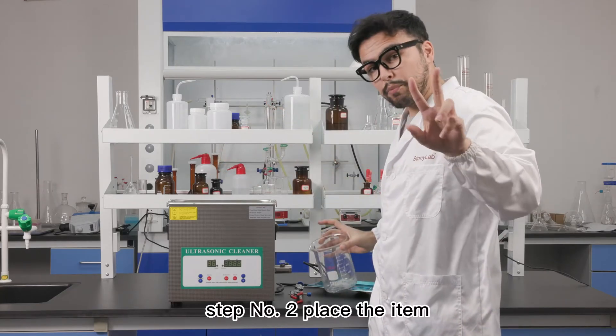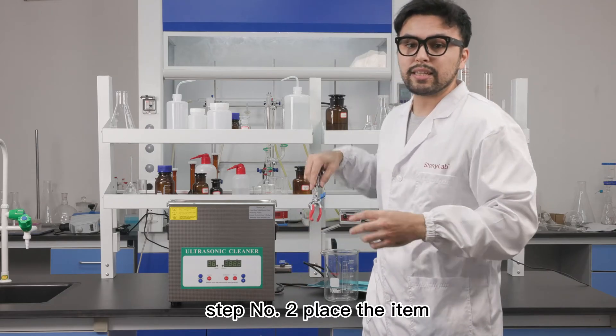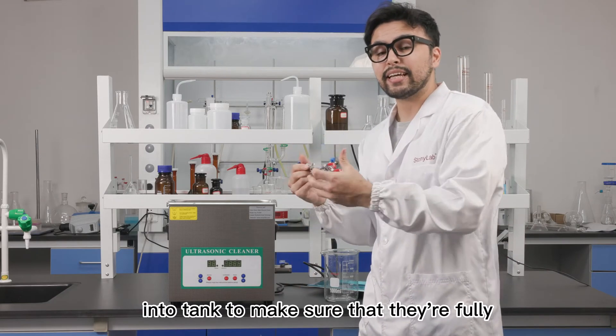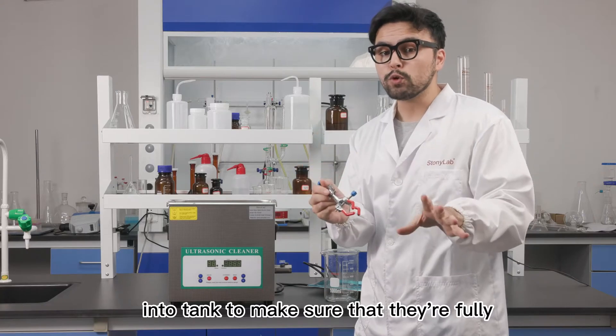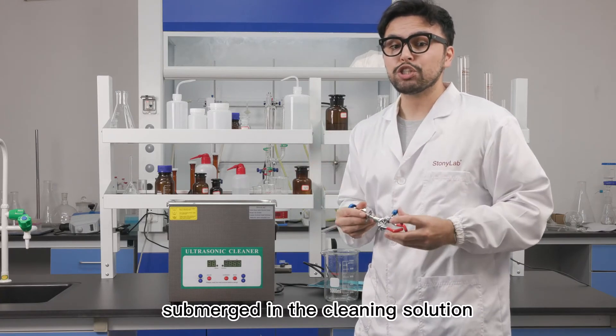Just like that. Step number two, place the item that you want to clean into the tank to make sure that they're fully submerged in the cleaning solution.